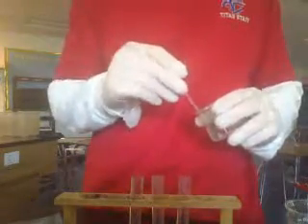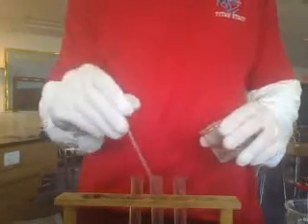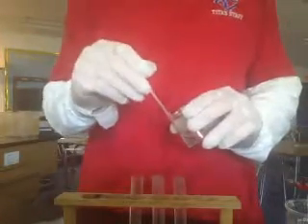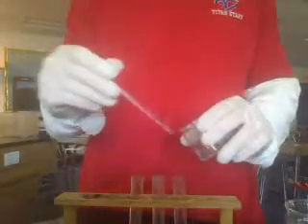So to demonstrate how that works, and again, we're looking at pH. If you look at vinegar, we're going to be adding vinegar to a solution of hydrogen peroxide. Vinegar is an acid. You'll need to look up just the pH of vinegar. But what I'll first do in our 3 test tubes here is add just some hydrogen peroxide, about 2 milliliters of hydrogen peroxide to each tube. There you go. There's 3. Do some more. It really doesn't matter. 1 or 2 is fine.